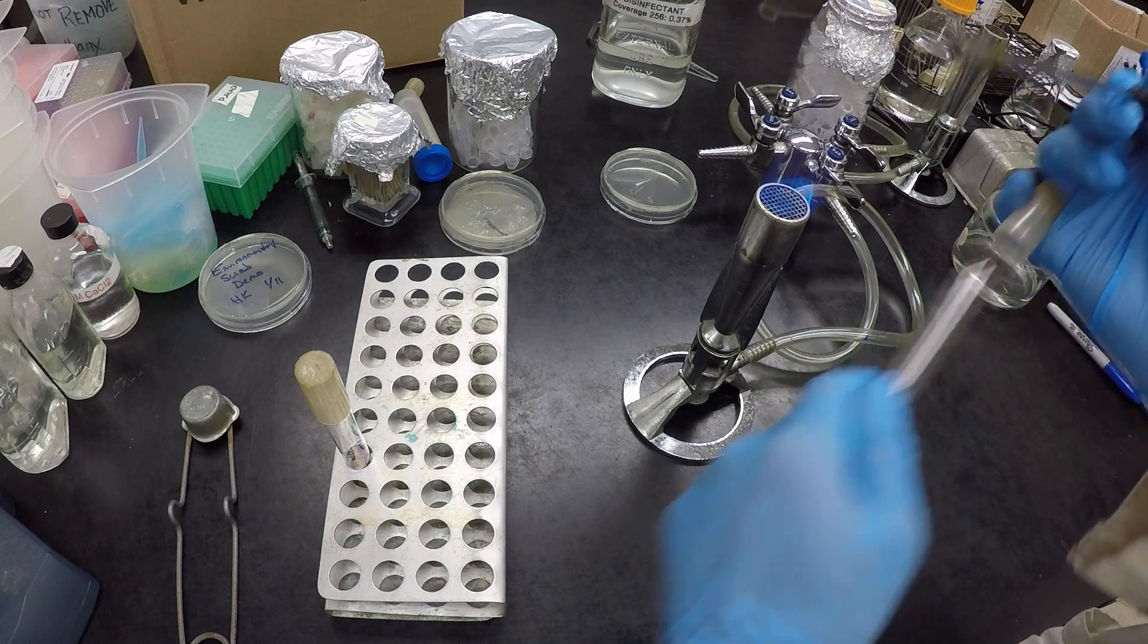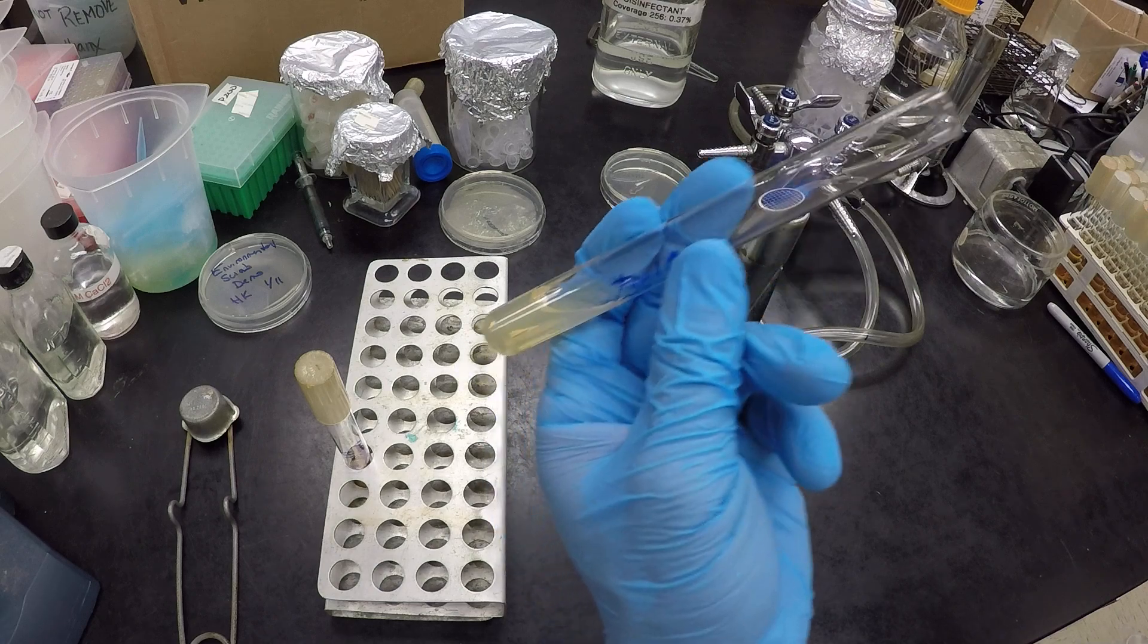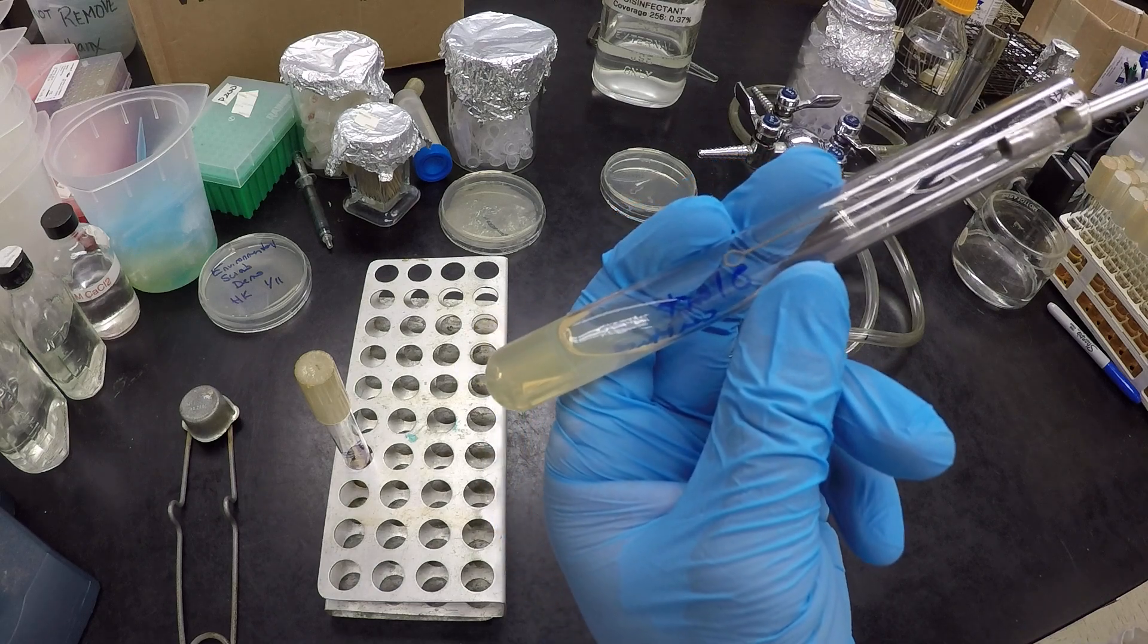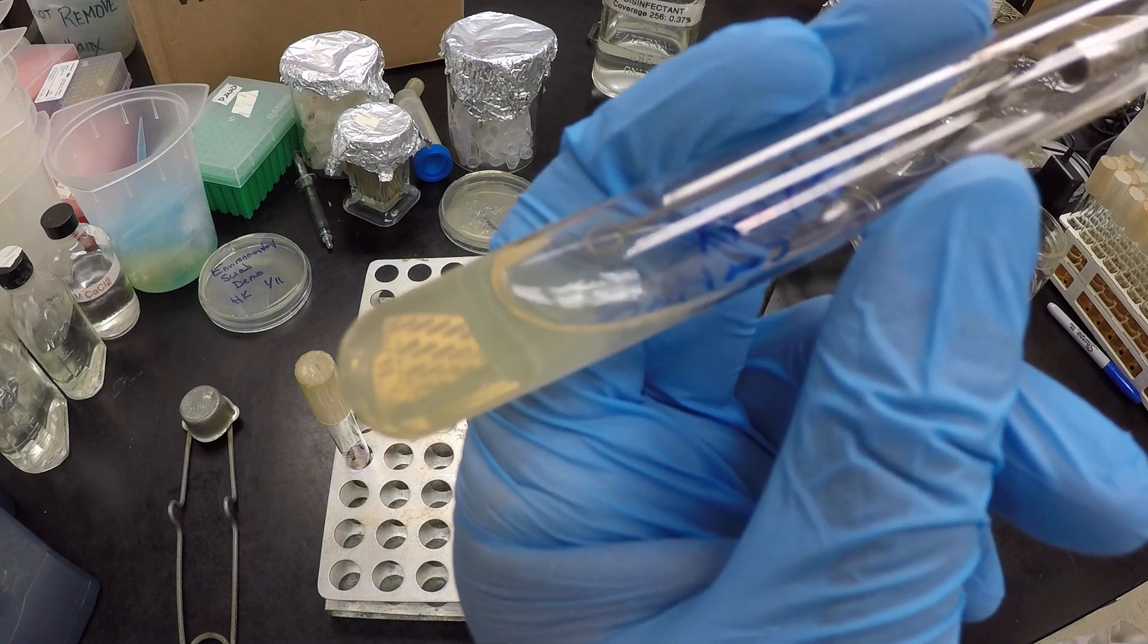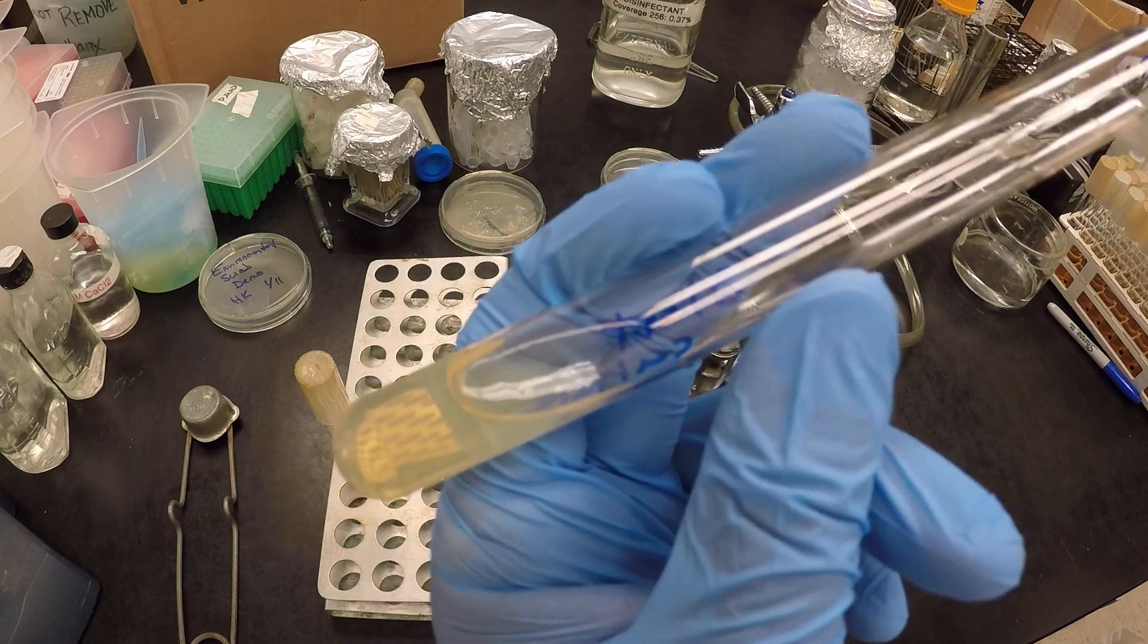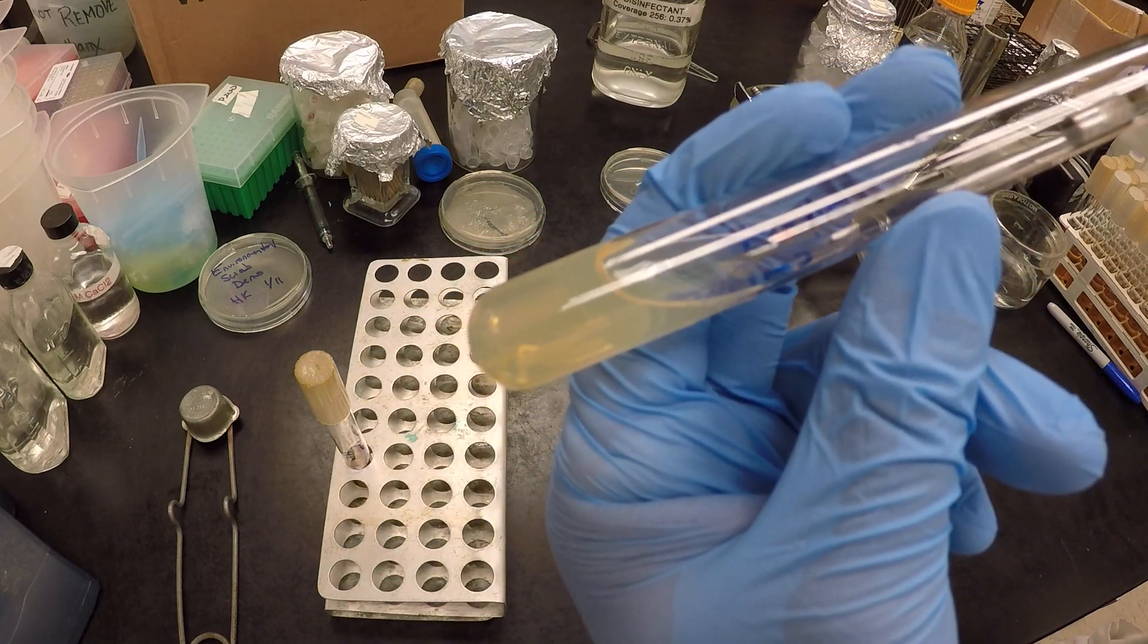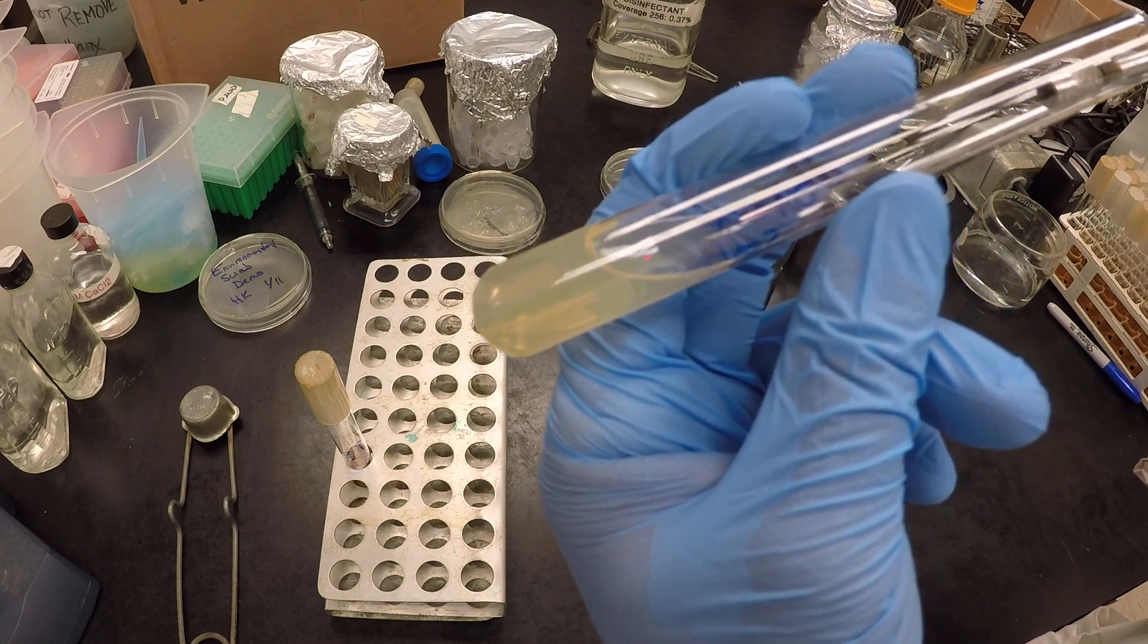So again, twist and turn, flame, and then for this, just touch it down like this. We're going to get nice and close, just touch it, and that's done. So no need to pull and drag, don't dig, just touch. That's all we want to do.